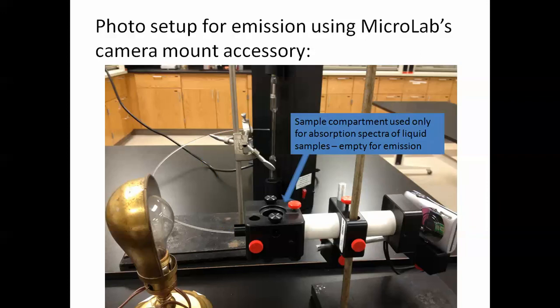There's a sample compartment also for liquid solutions in a 21 millimeter vial that Microlab supplies. Now, for emission spectra we don't use this. That's just for absorption spectra, so we can shine the light through the slit and watch the absorption of certain colors by the colored sample. In this case, though, for emission, we wouldn't have that. We would just put a dark cloth over this to minimize the stray light.